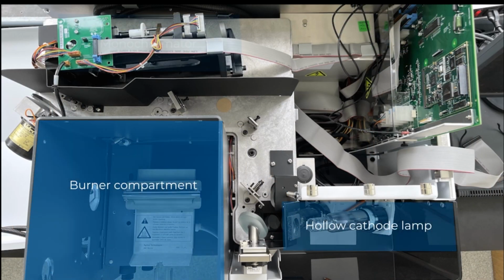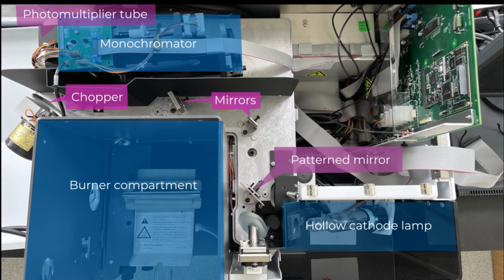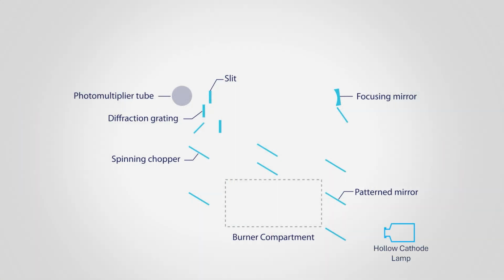This is a top view of the instrument with the cover off. Let's take a look at the path light takes as it travels through the instrument. Light from a hollow cathode lamp is split by a patterned mirror into a reference beam and a sample beam. The sample beam passes through the burner compartment while the reference beam bypasses it.